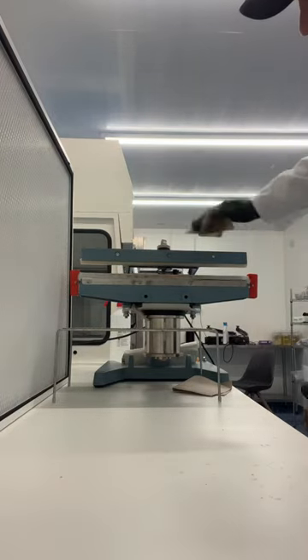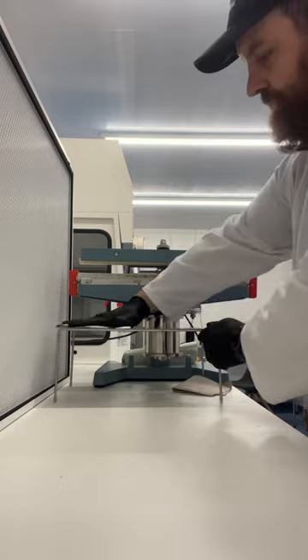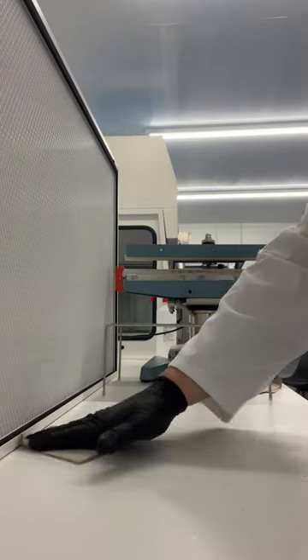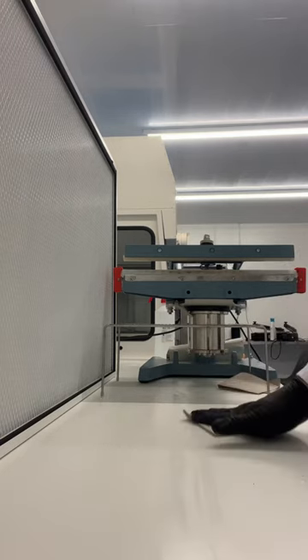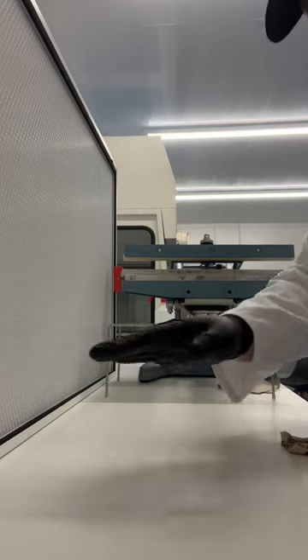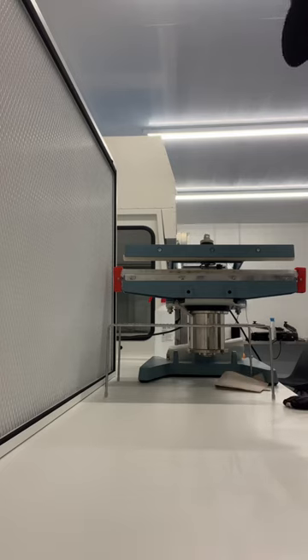Then I work from top to bottom, back to front. With the actual surfaces themselves I'll literally snake backwards and forwards — just slowly, you don't want to go absolutely mad with this. Backwards and forwards, working from the filter backwards. That way you're not scrubbing in a circular motion, which would just move particles backwards and forwards across your workspace. And that's it really.